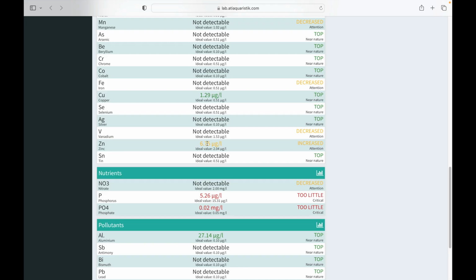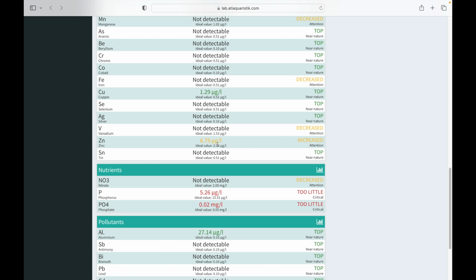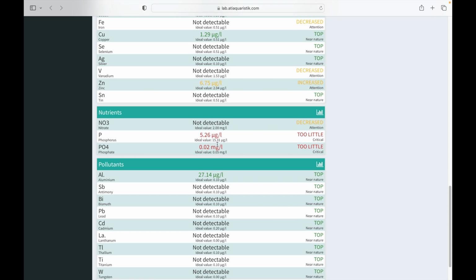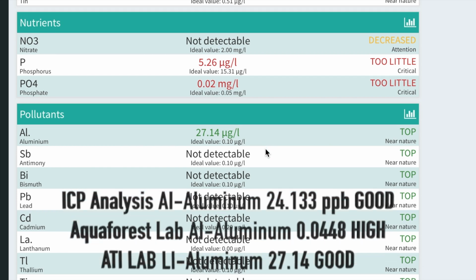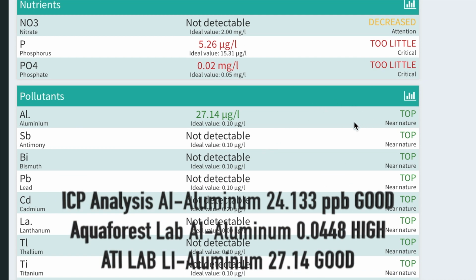So which is it? Is it high? Is it normal? Or is it low? Each lab has a different result for that reading. What's the last one? Aluminum. Okay, this one's showing aluminum as being normal, near nature range. Aquaforest Lab says, if you recall, the aluminum was high.